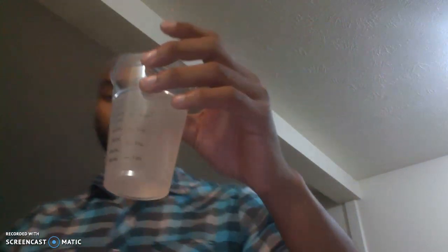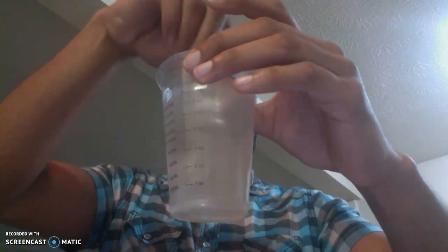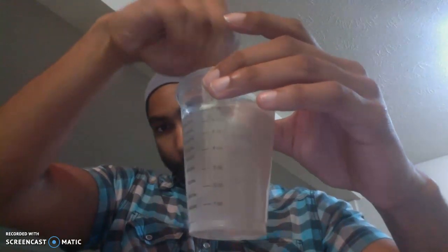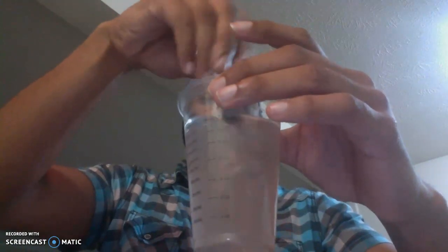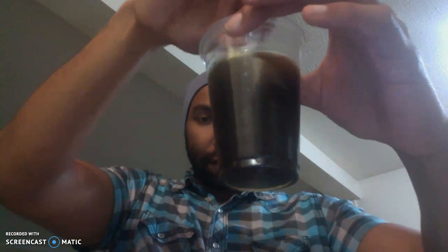I'm just going to stir it a little bit. And I know this reaction could take a while. There you go.